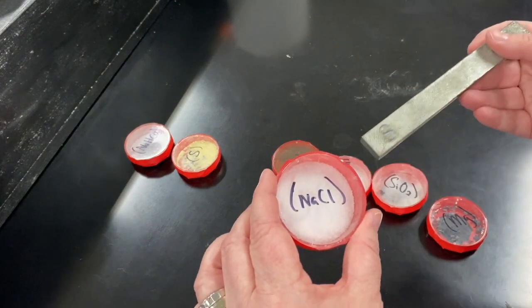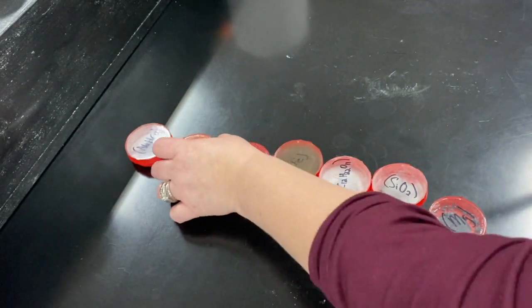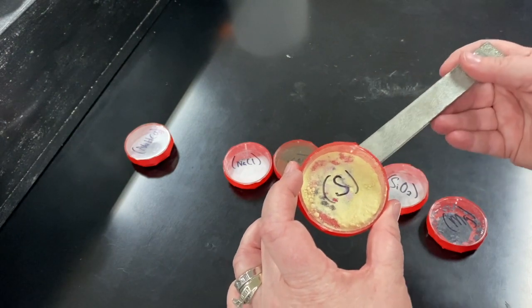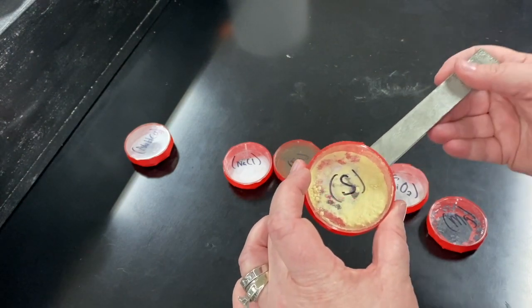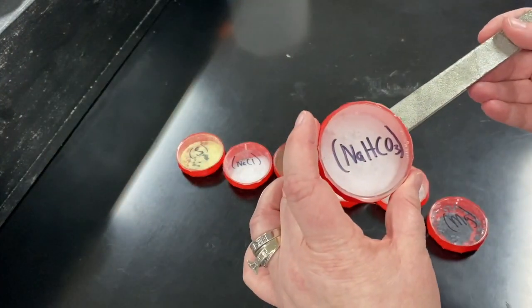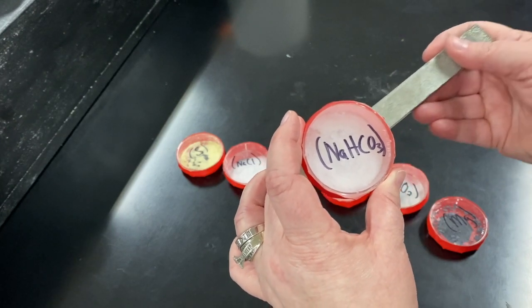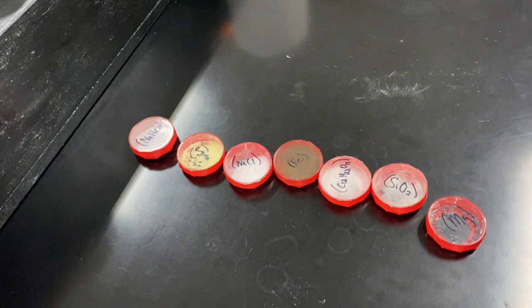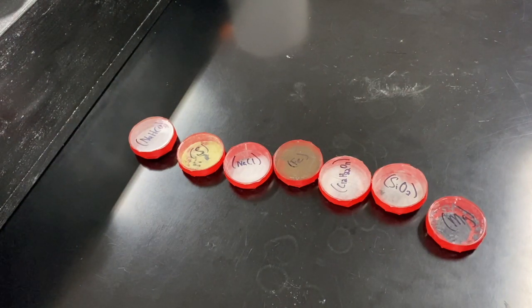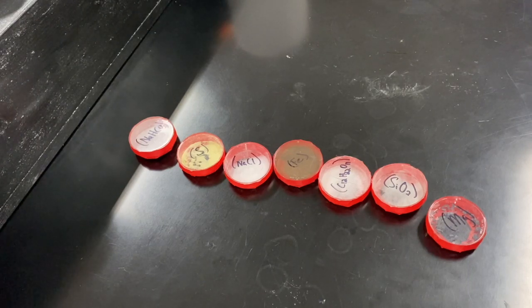Sodium chloride — not seeing anything, no movement. Sulfur — not seeing anything, no movement. And the baking soda — no movement there. So the only one that actually did have a reaction to the magnet was the iron. That was procedure A, steps one and two.